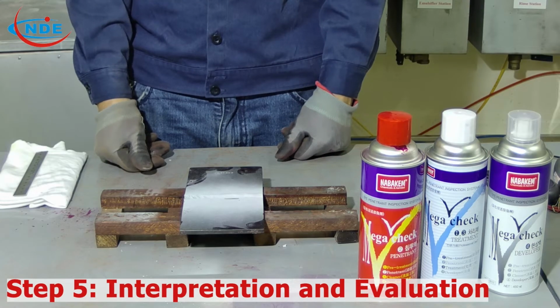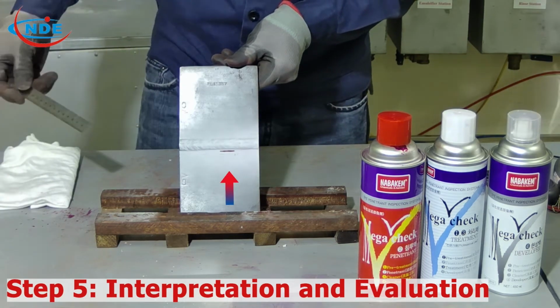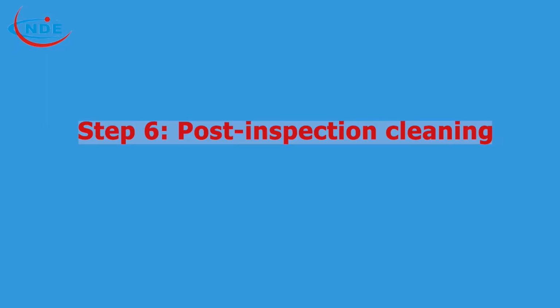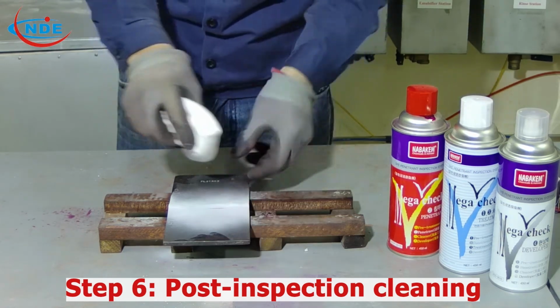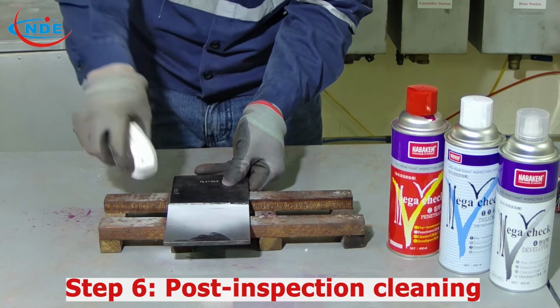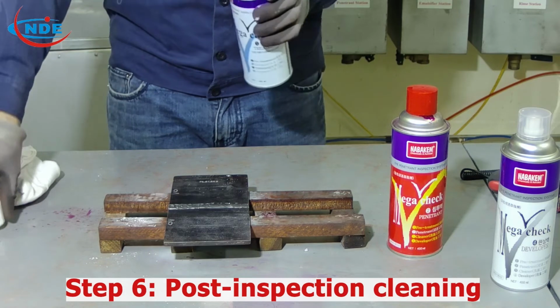Step 5. Interpretation and evaluation. Measure the size of the continuous indication and evaluate according to the applicable standard. Step 6. Post-examination cleaning. Using the solvent spray bottle and clean rag to remove used material on the surface of the testing object. Ensure that the penetrating material doesn't damage the object.